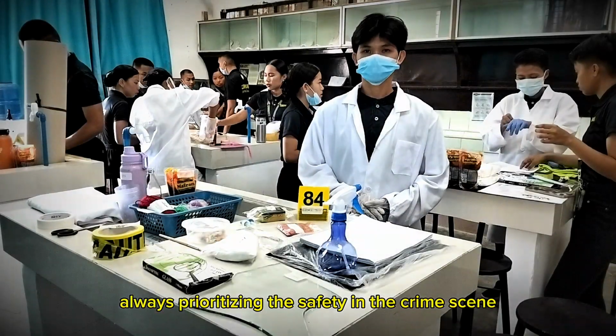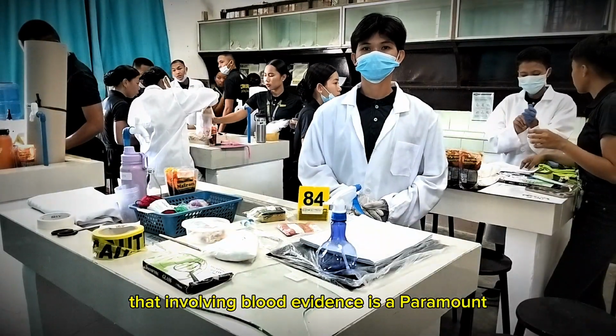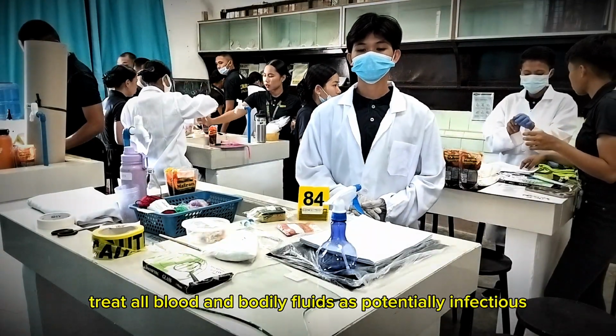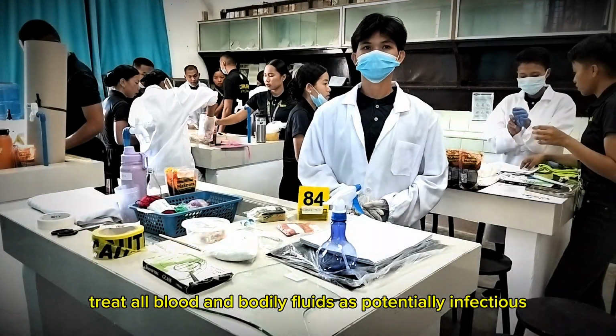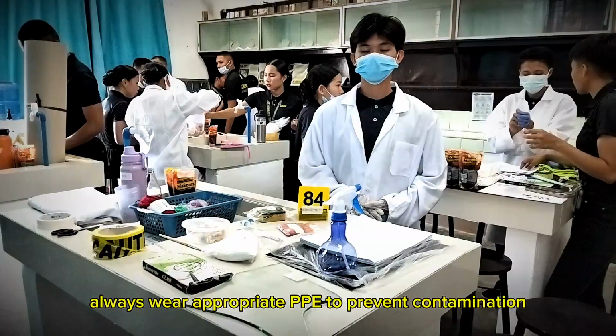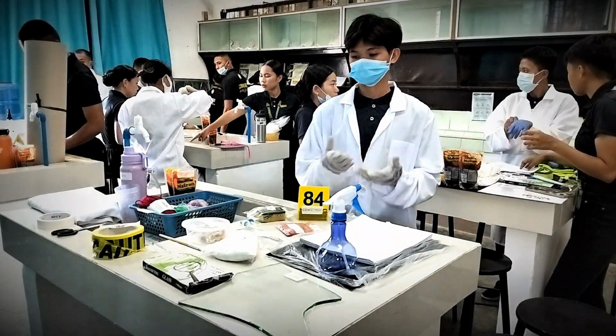Always prioritize safety in a crime scene involving blood evidence, as it is paramount due to potential biohazard. Treat all blood and bodily fluids as potentially infectious. Always wear appropriate PPE to prevent contamination or exposure to blood-borne pathogens.